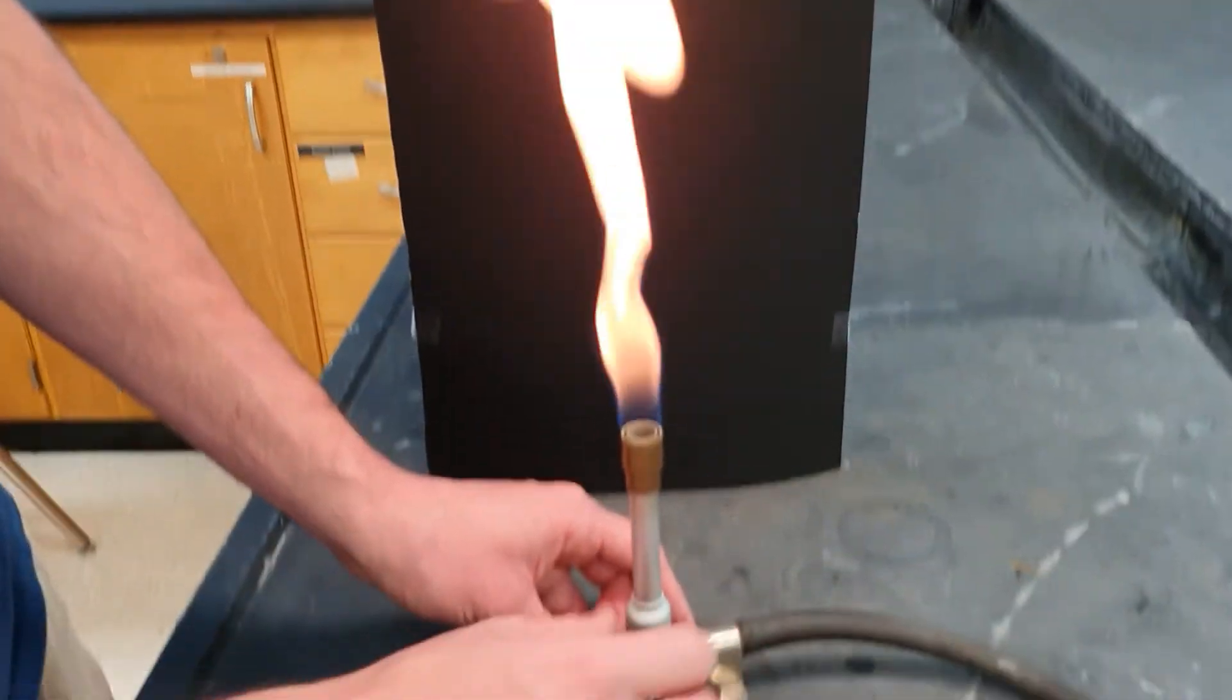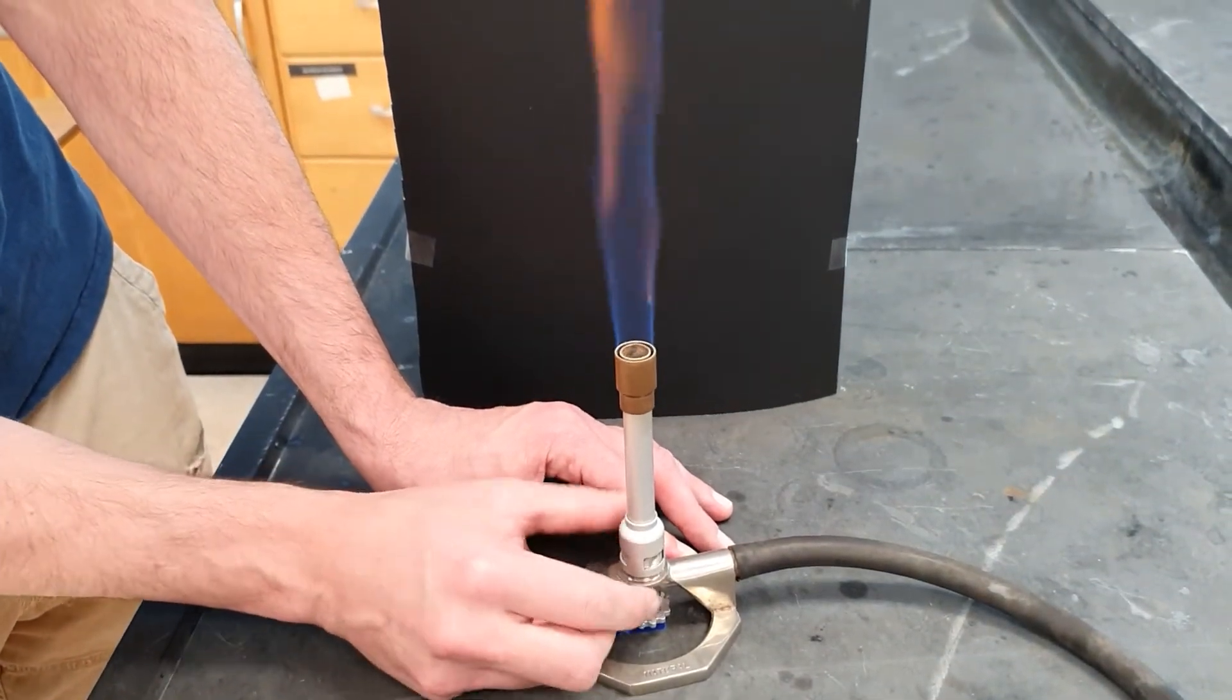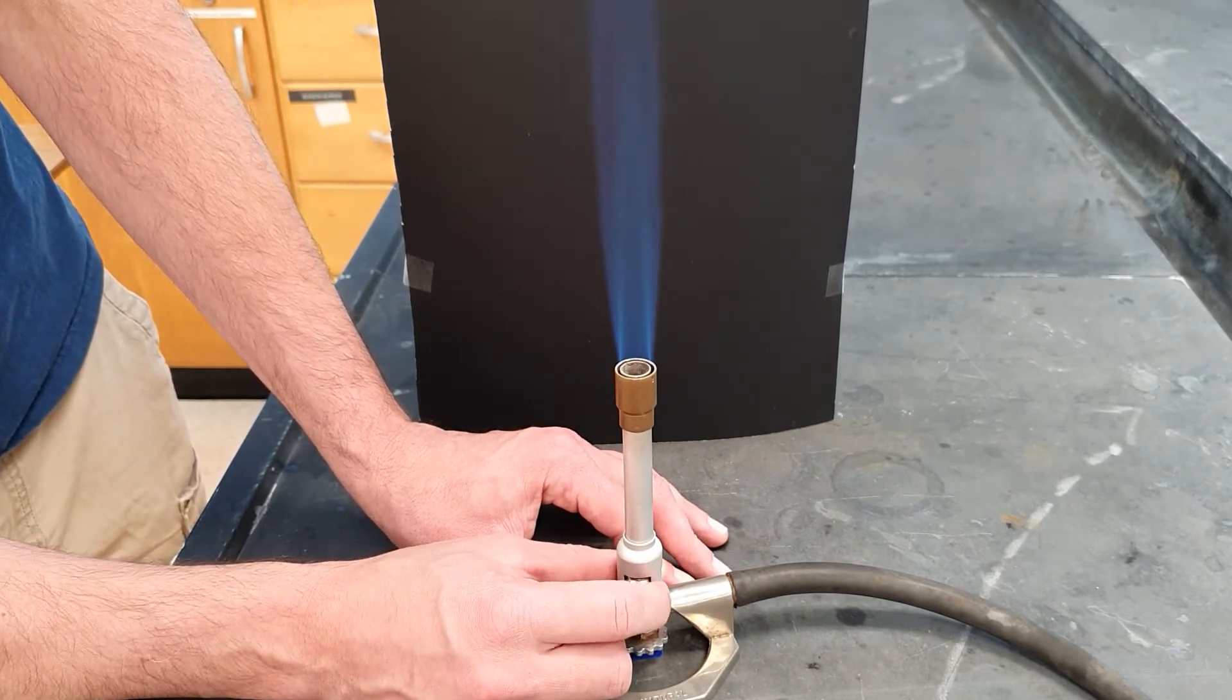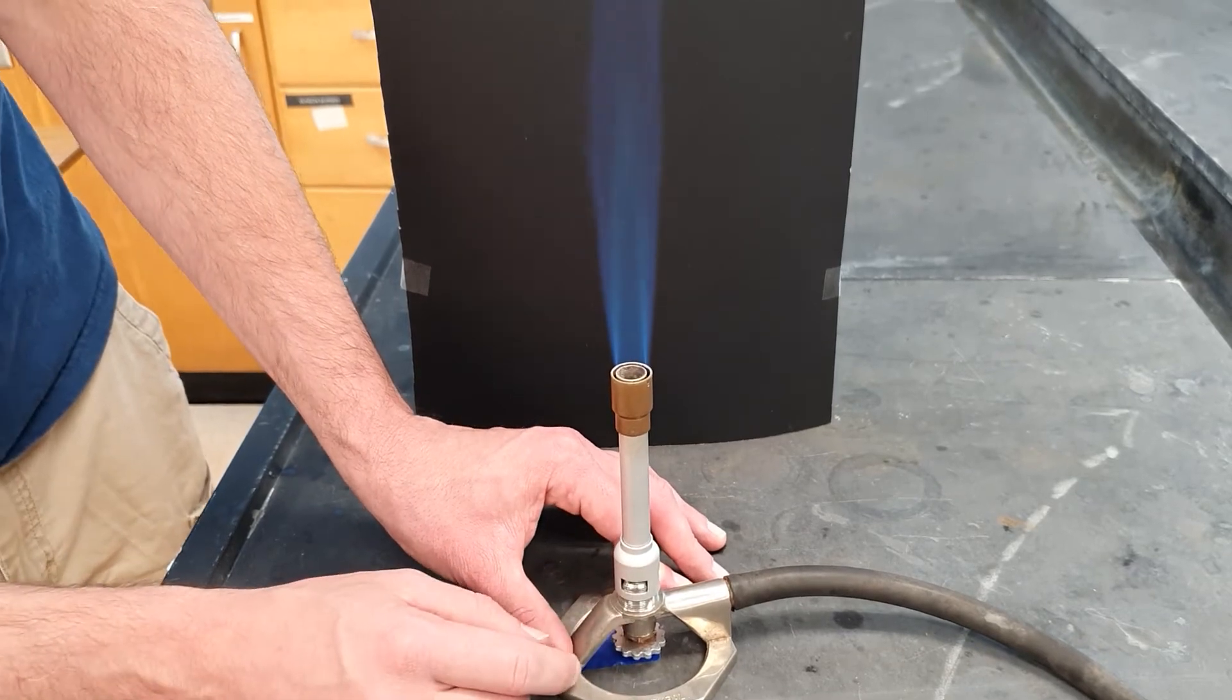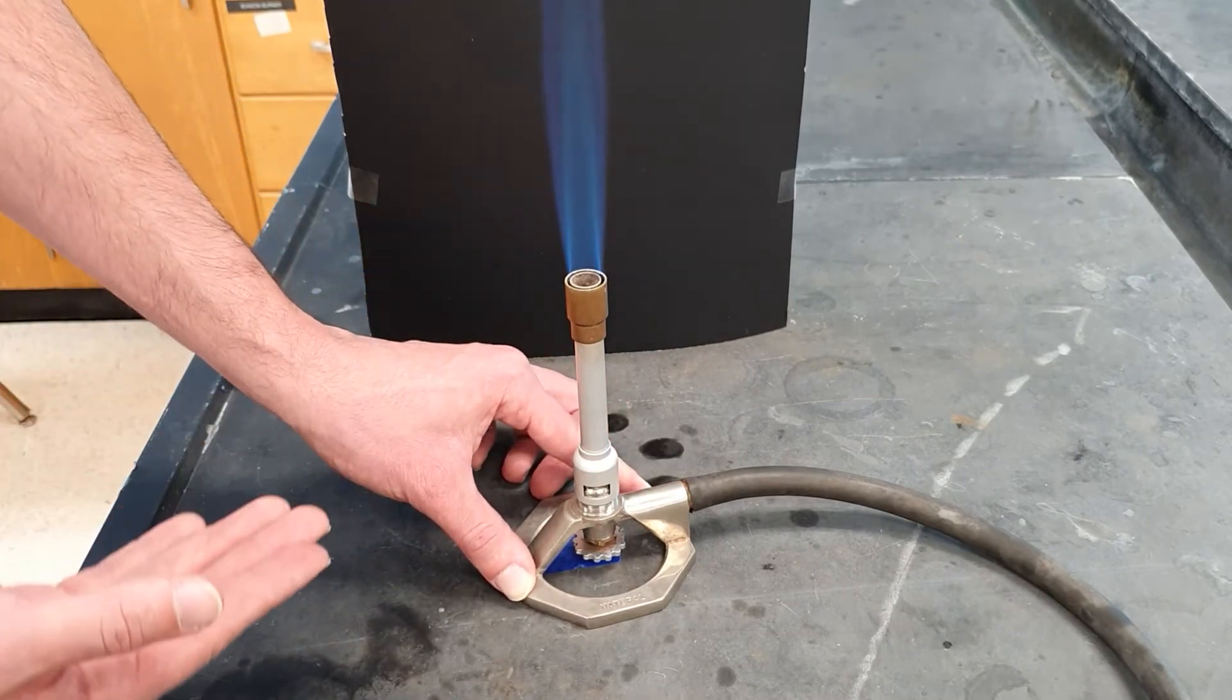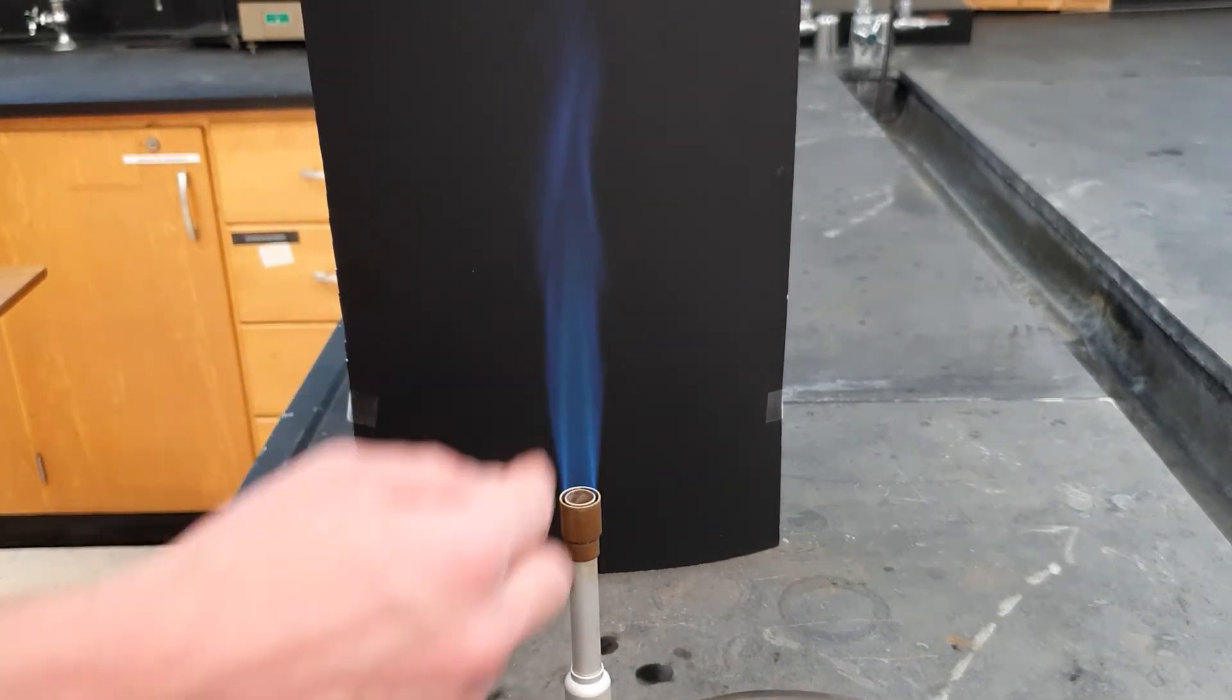So what I'm going to do now is adjust the airflow, and now I'm going to open this valve, turning it down here. Notice how I'm using one hand to steady the gas burner and the other hand to open the valve. I'm actually using my thumb. You can either use two fingers or just one, but you've got to go a little ways toward opening it up. When you're done opening it, you want to have it so that the valve is about, screw roughly three quarters to eighty percent of the way up, leaving this mostly open. So we say, in other words, turn on the gas, light the flame, and then open the air all the way, and then when the air is open all the way, you'll notice that the flame is blue because it's got much more oxygen in there.